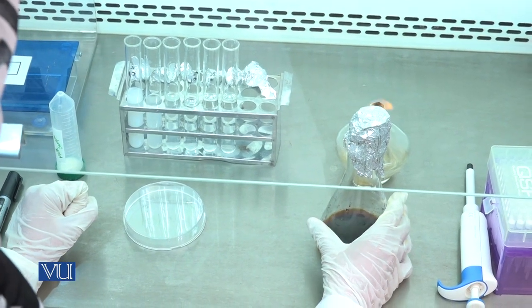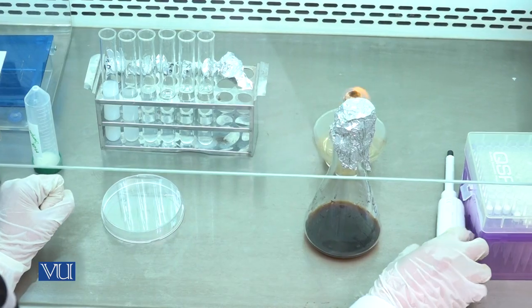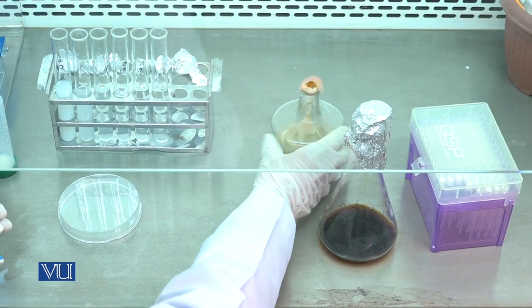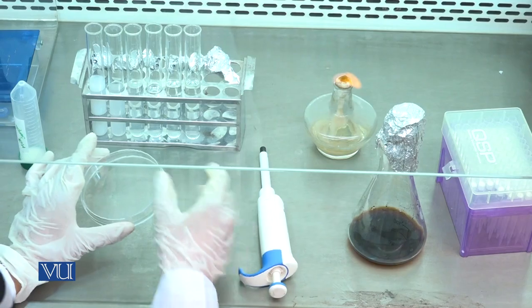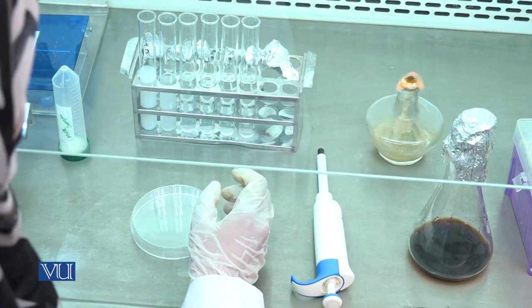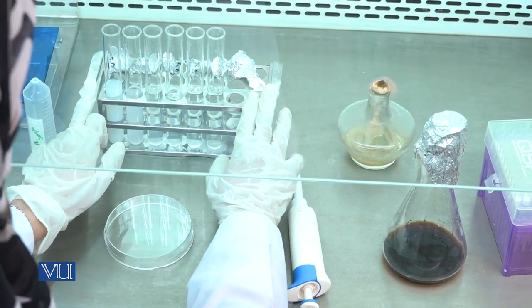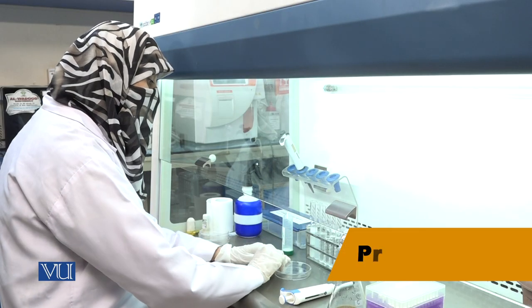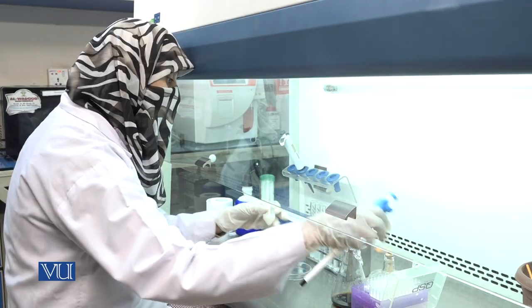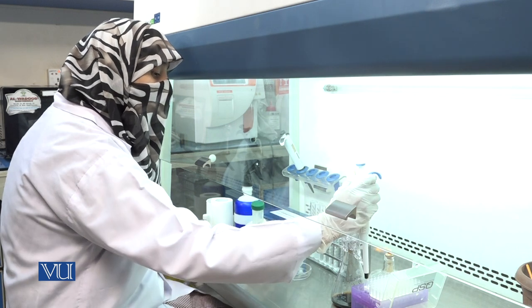Reagents required: MRS agar, which is favorable for the growth of Lactobacillus species; micropipette; tips; burner; sterile petri plate; milk sample; labeling marker; and serial dilutions of sample. First, take 5 ml of milk sample and set the micropipette at 1 ml, which is equal to 1000 µl.